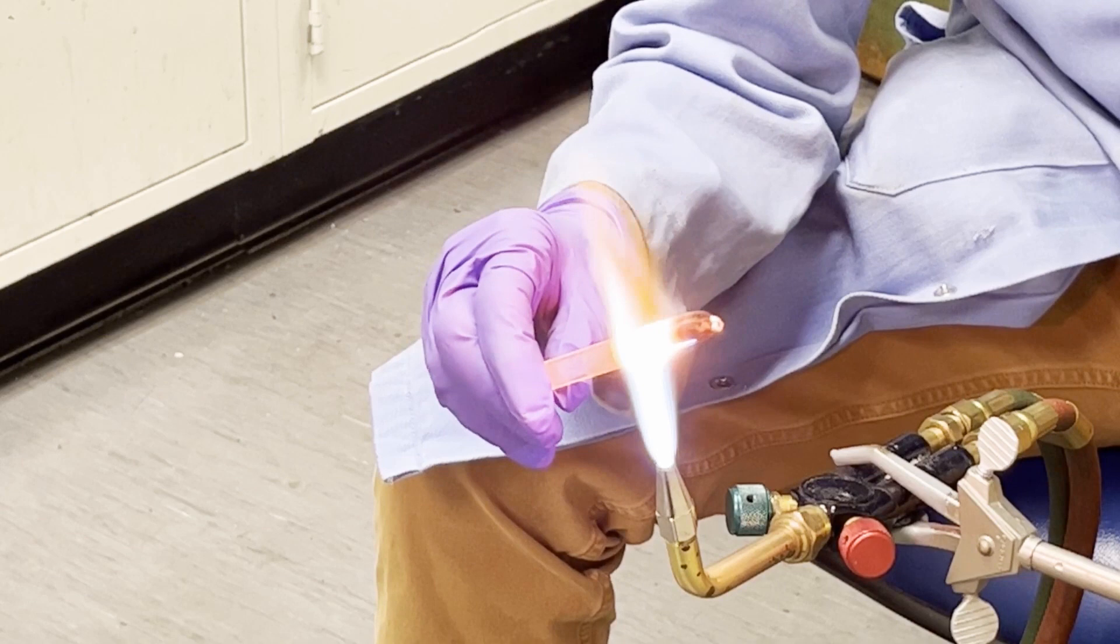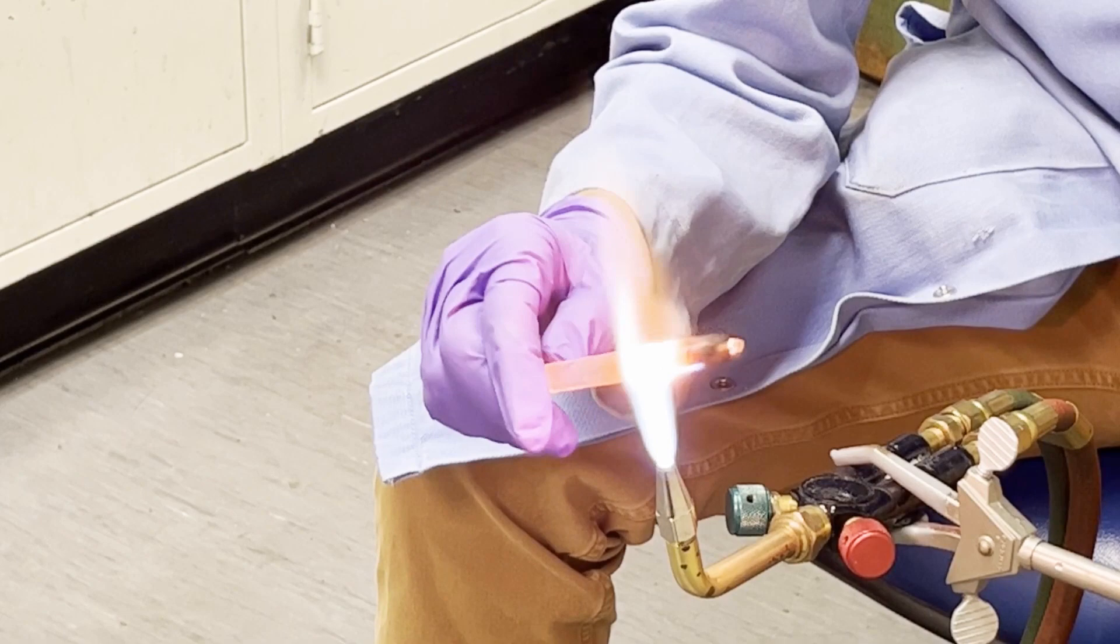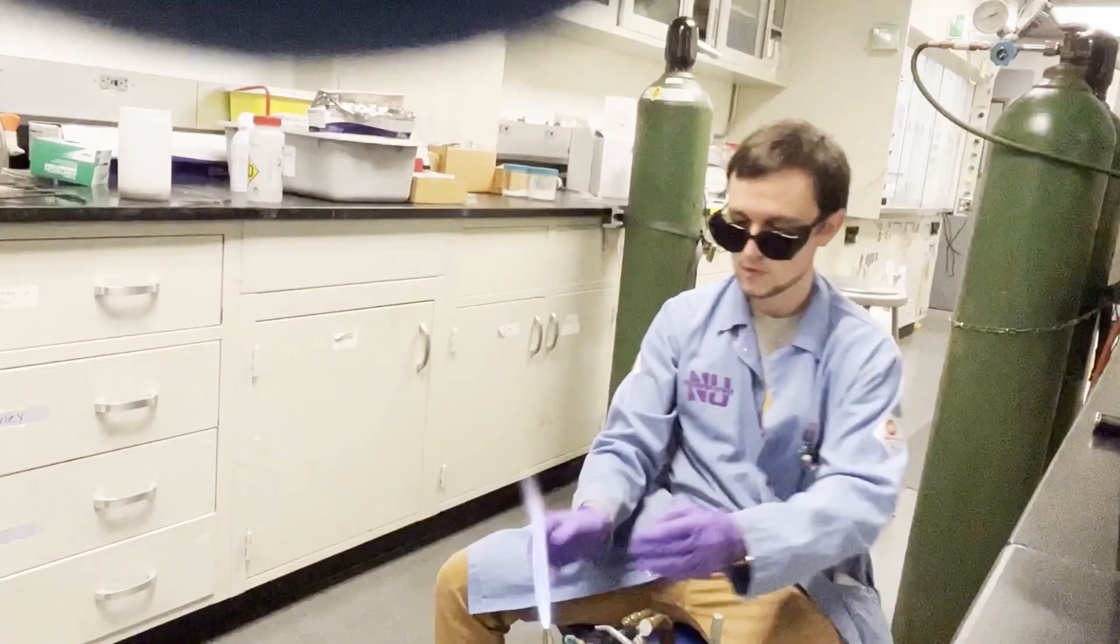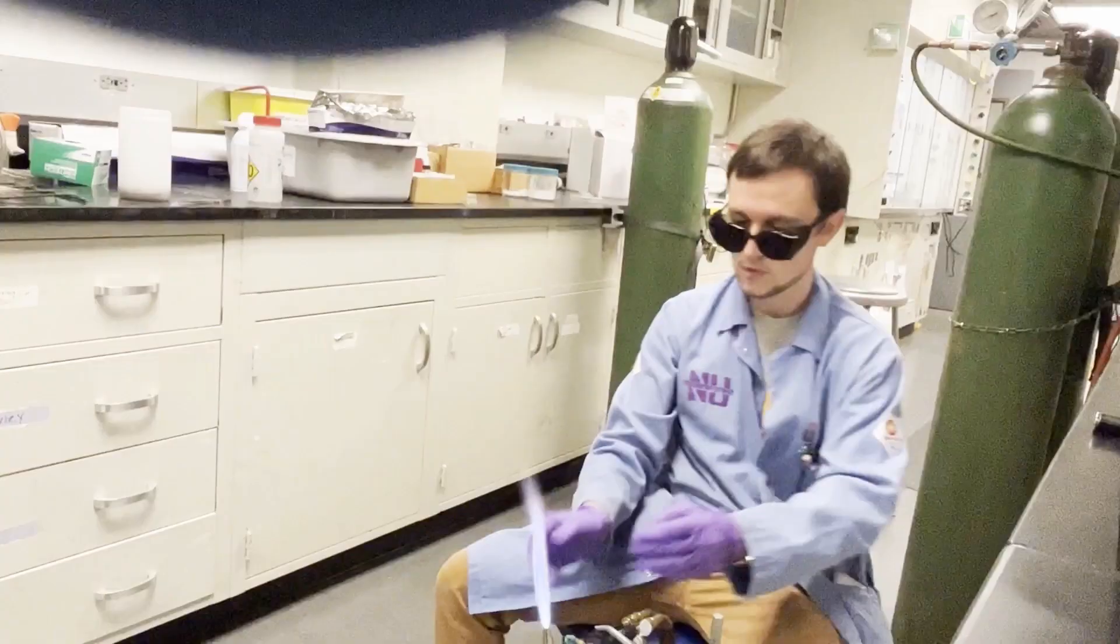Honestly, we're getting to about a couple inches and this is probably a good amount for you to still have plenty of tube to seal on and for it to contain your entire reaction mixture. We're going to put that down, turn the torch off, and that's it.